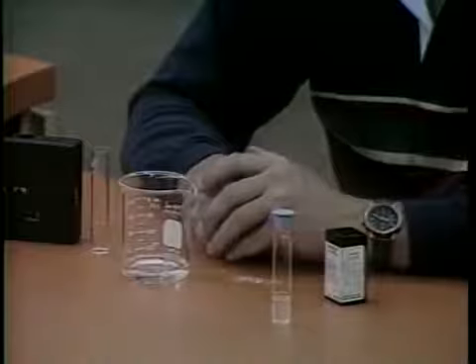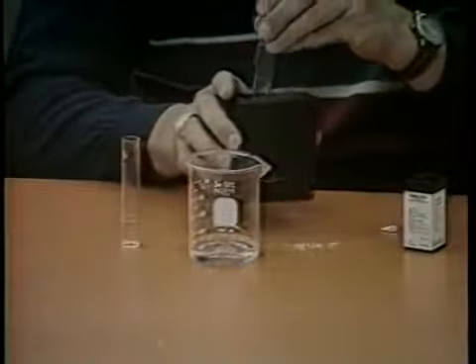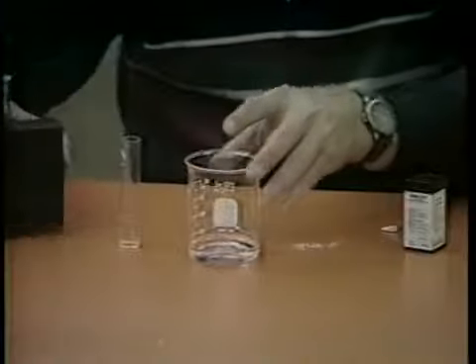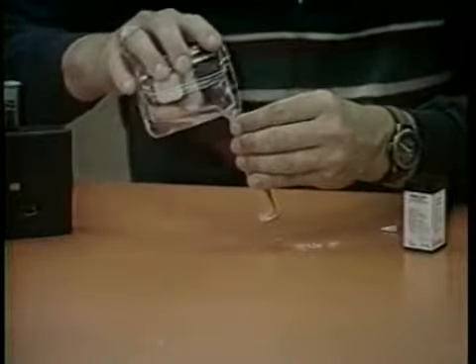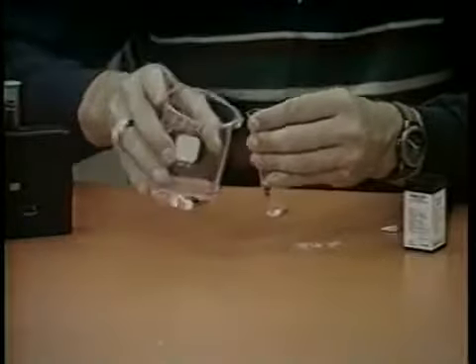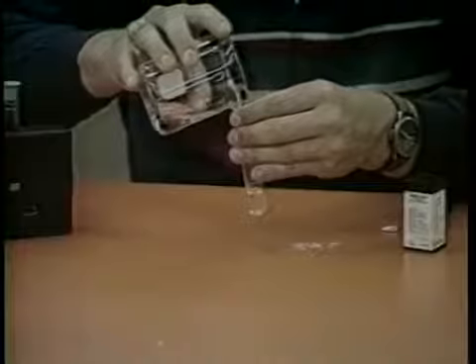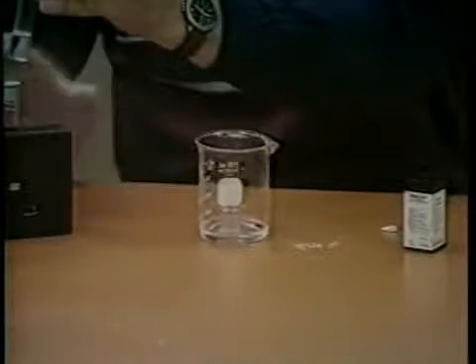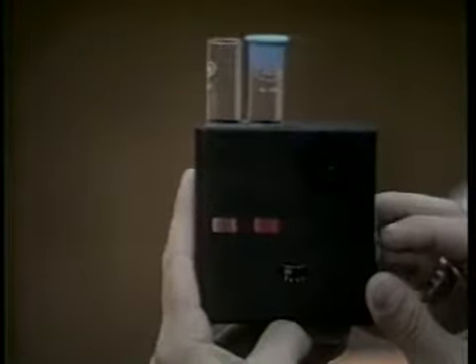Insert the tube into the opening on the right of the color comparator. Fill the other viewing tube with 5 ml of water from the sample and insert it into the left compartment. This tube cancels out any color that is present from the pond water. Hold the comparator up to a light source and rotate the disc to obtain a color match. Read the disc to obtain the milligrams per liter of nitrite nitrogen.